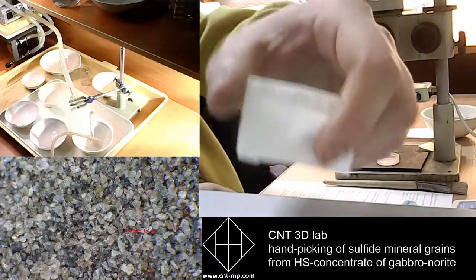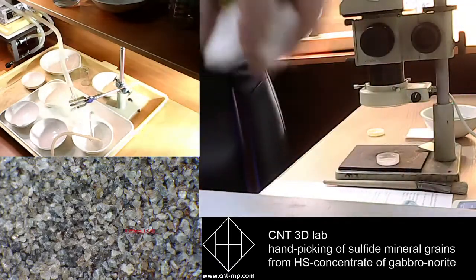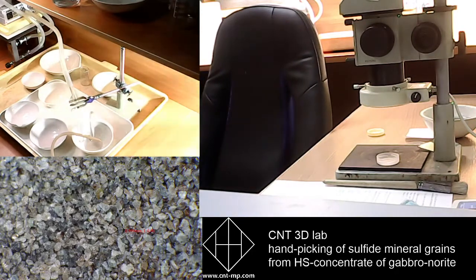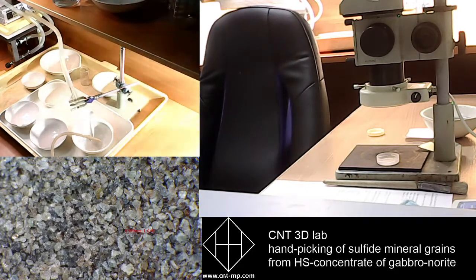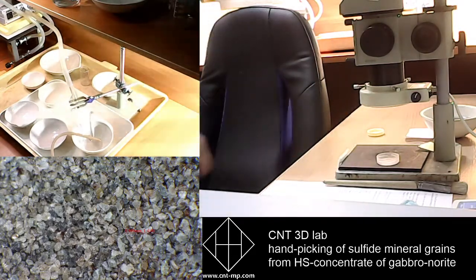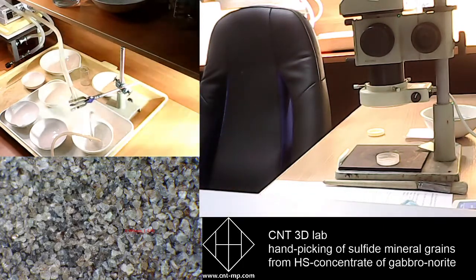So now we've finished, and the next stage, as I mentioned, we have to ask the client what kind of mineral analysis is needed for further mineral research. There are a lot of methods we can use for mineral identification, but the most common are scanning electron microscopy and electron probe microanalysis.